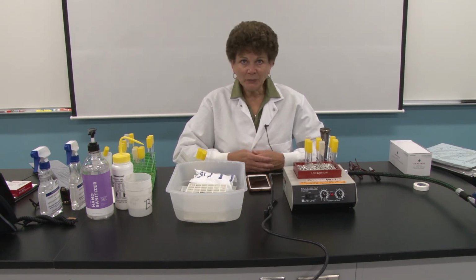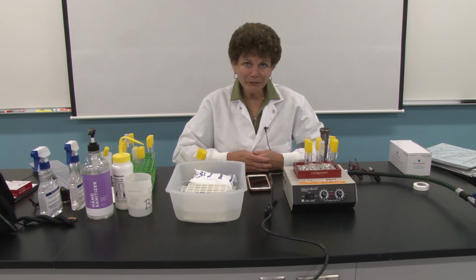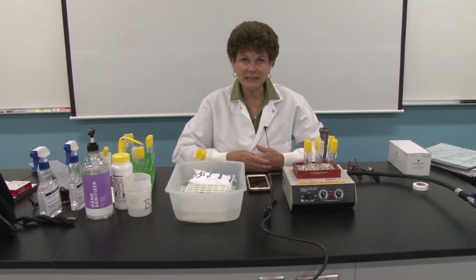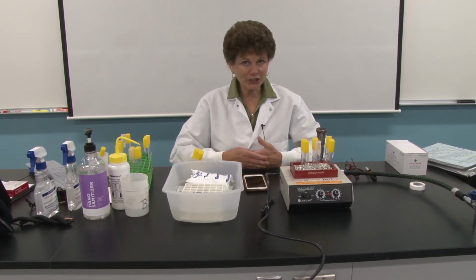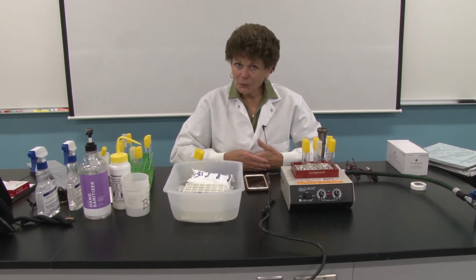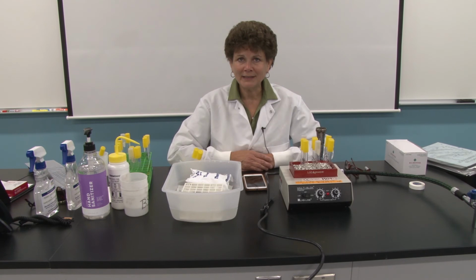So today, what we are going to do is expose 3 different bacteria to boiling temperatures for various lengths of time. These 3 bacteria you are already familiar with. The first one, Staphylococcus aureus, is our control gram-positive bacterium. The second one, Escherichia coli, you know is our control gram-negative. And the third one, Bacillus subtilis, is also gram-positive like Staph aureus, but what it does that Staph doesn't is it produces bacterial endospores, those dormant bodies.